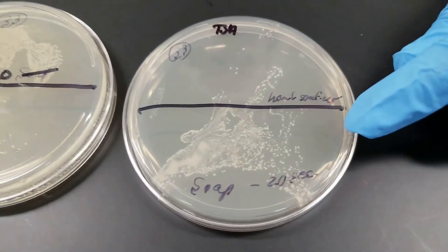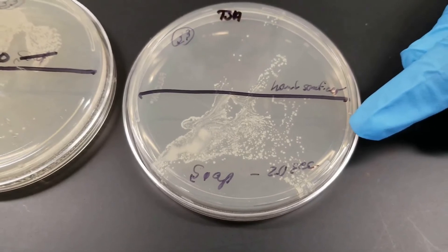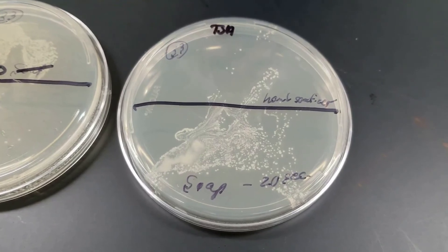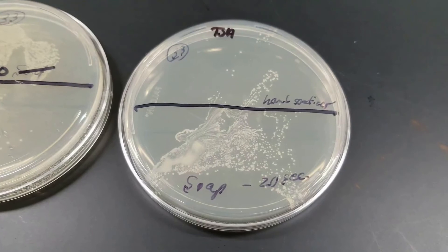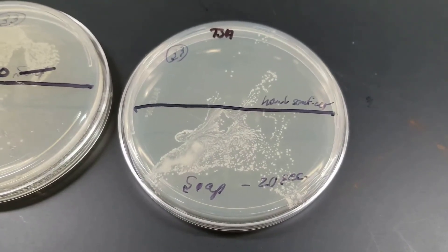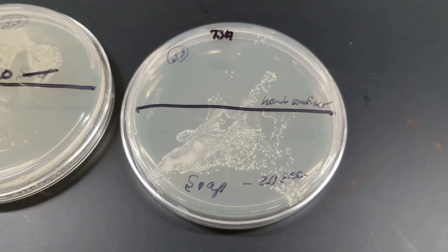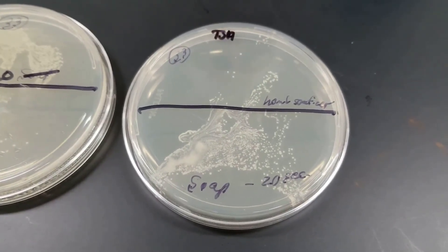Over on this plate at the bottom, this is where I washed my hands with regular soap for 20 seconds, which is the recommended time period. Once again, I'm touching the water faucet, touching the soap dispenser, and in between I also used paper towels and touched the paper towel dispenser — so that might be where some of the bacteria is also coming from.